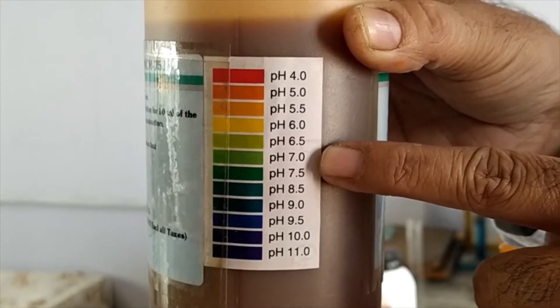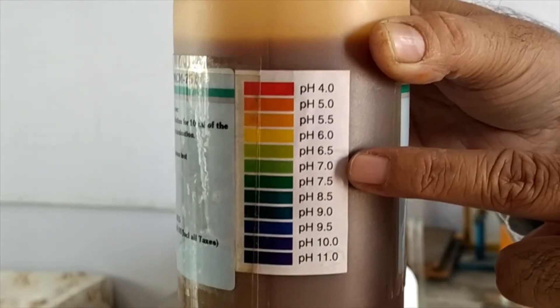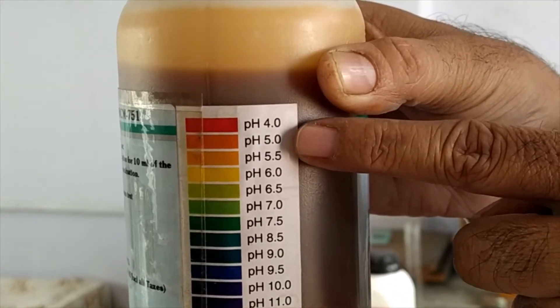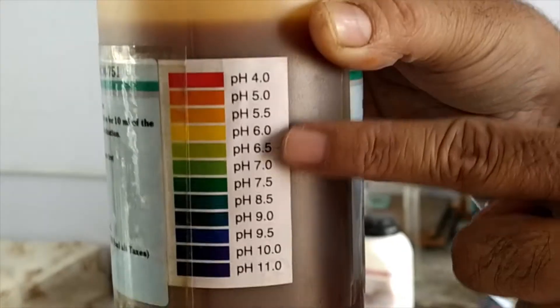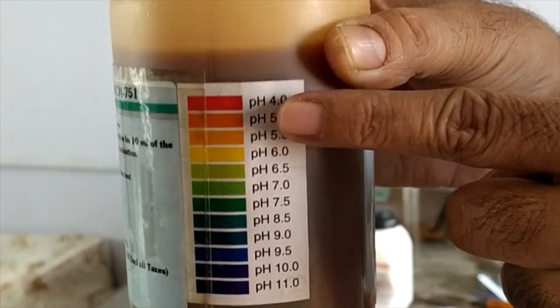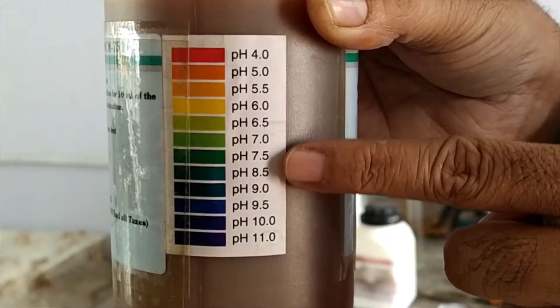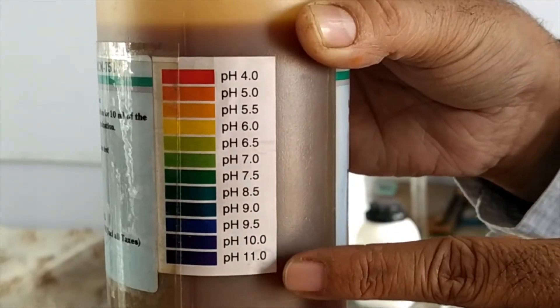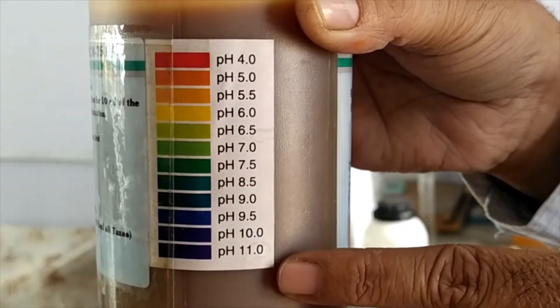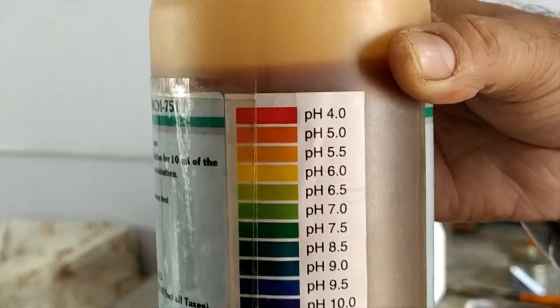In your journal we are going to write in the boxes. Below 7 — that is 6.5, 6, 5.5, 5, and 4 — these are acidic solutions and you can see the different colors. The same colors you will see when we test the samples. Above 7, these are all basic solutions and the pH goes from 7.5 to 11. Observe the color change when we take the sample.